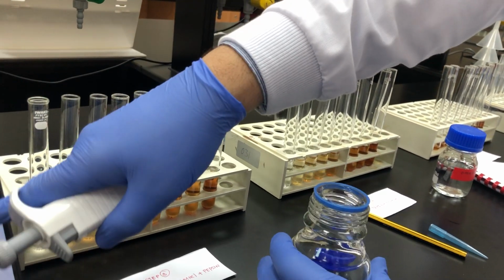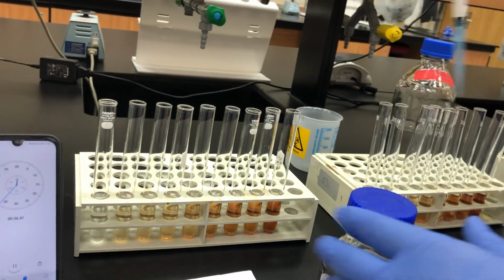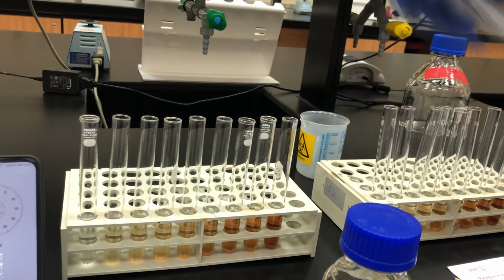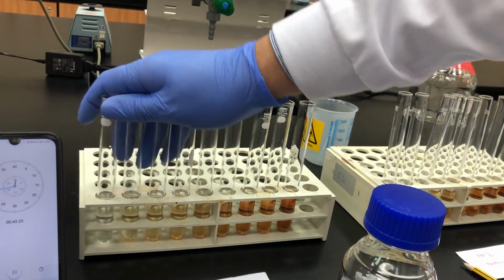So I will wait till the timer reaches 10 minutes. And this is very important: we have to mix. I have the mixer, and I will mix. I will keep it here for 10 minutes.